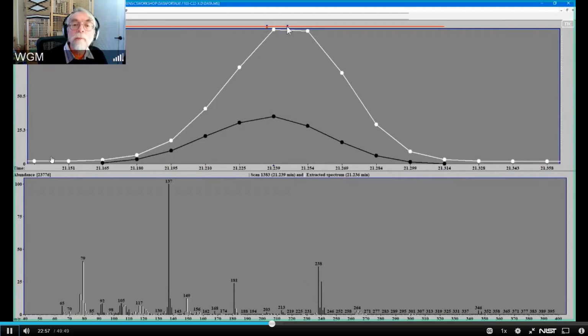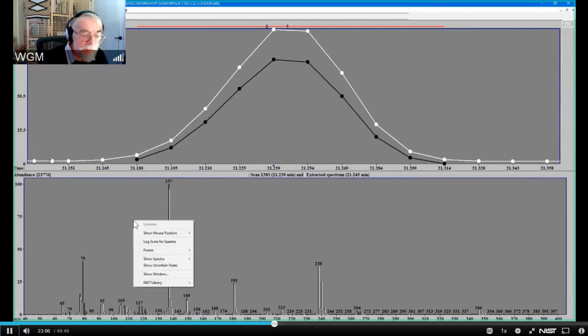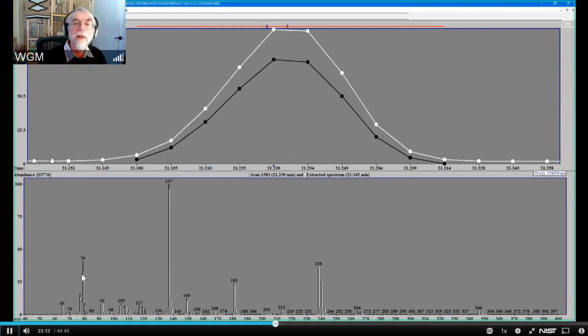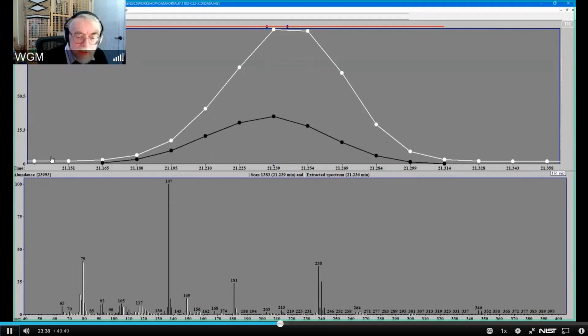For this component, these are the confident peaks. And as you can see, if I tell it to show the uncertain peaks, you see the 79 is uncertain. You can see why, because it's not peaking much different than the other peaks. If you were to do this in a conventional way, where you average this entire thing, you really wouldn't get rid of this 79. But I can not show the uncertain peaks, and then it becomes very clear what I've got here. I've got this set of peaks, and I've got this set of peaks.